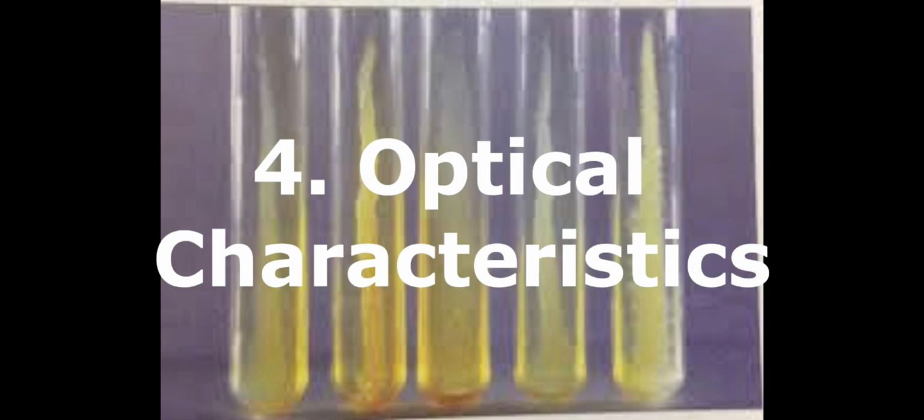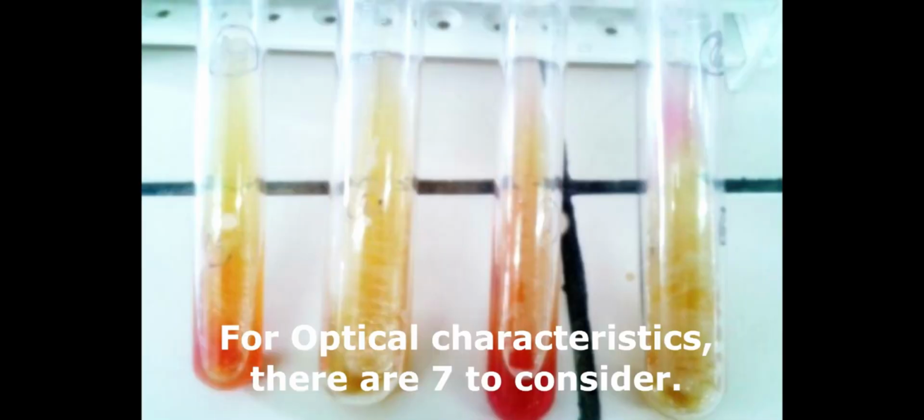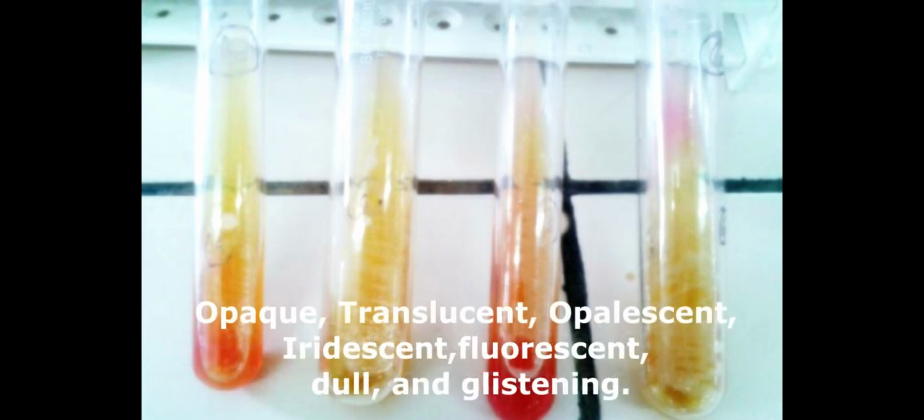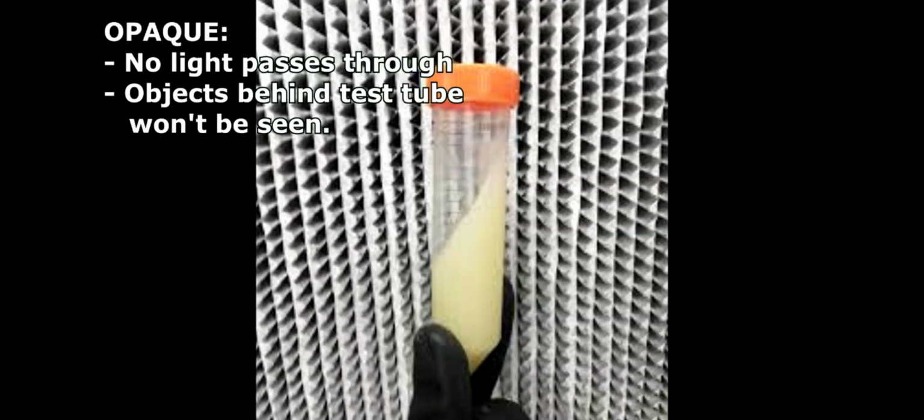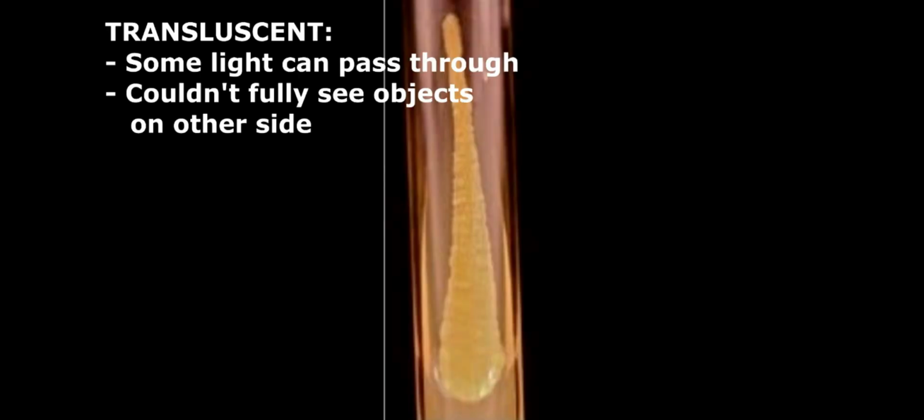Number 4 in examination of agar slant culture is optical characteristics. For optical characteristics, there are 7 to consider: opaque, translucent, opalescent, iridescent, fluorescent, dull, and glistening. For opaque, no light passes through, and objects behind the test tube wouldn't be seen. Translucent: some light can pass through, but you couldn't fully see the objects on the other side.